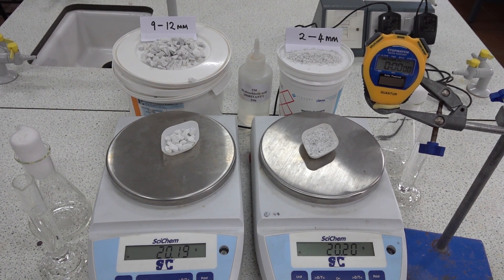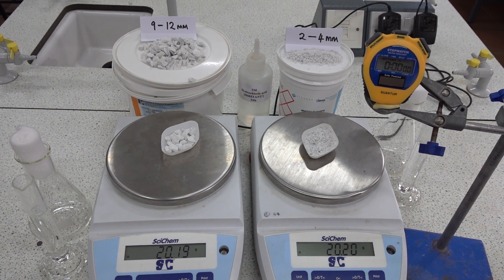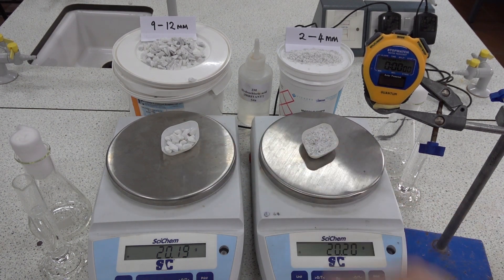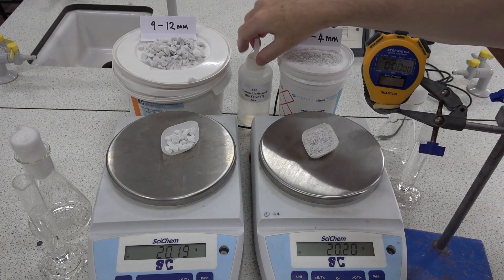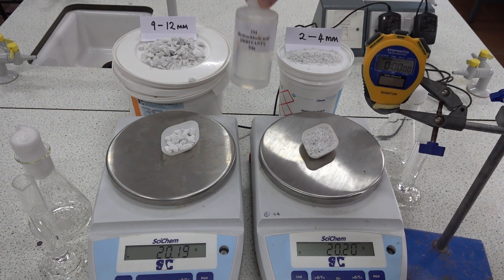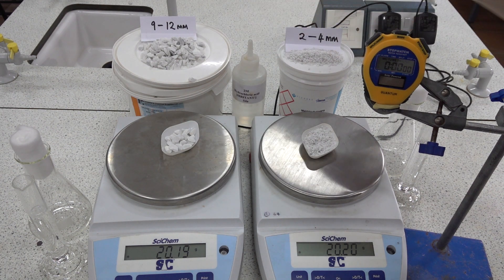Investigating the effect of surface area on the rate of a chemical reaction. We've got large and small marble chips and we're going to be looking at their reaction with 2 molar hydrochloric acid.